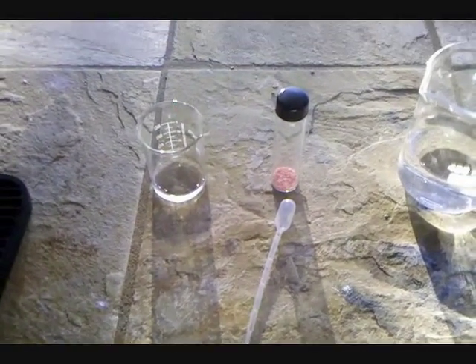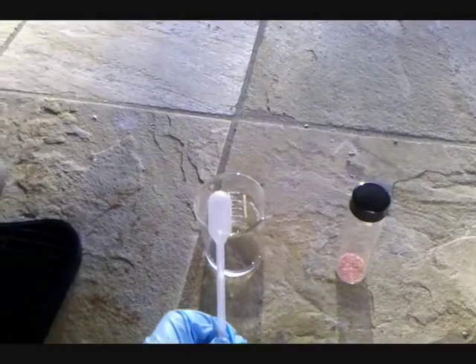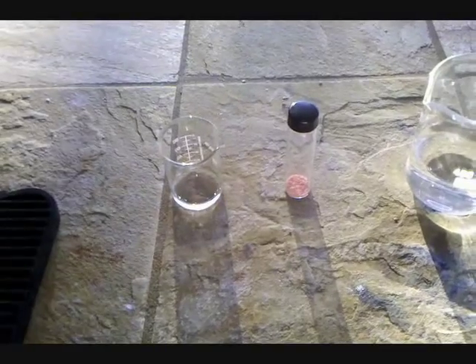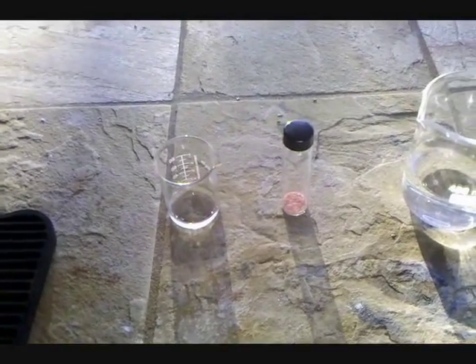So I'm going to be slowly adding the concentrated sulfuric acid to the dichromate chloride mixture and showing you the chromyl chloride once it's synthesized. Chromyl chloride has been produced in the vial and can be seen as this dark red liquid at the bottom.